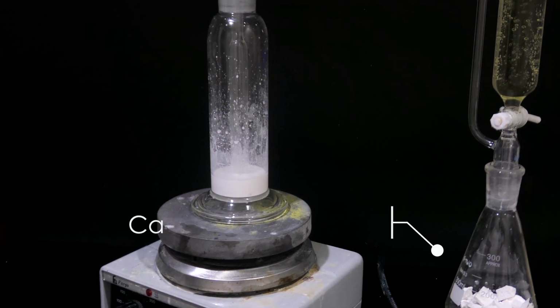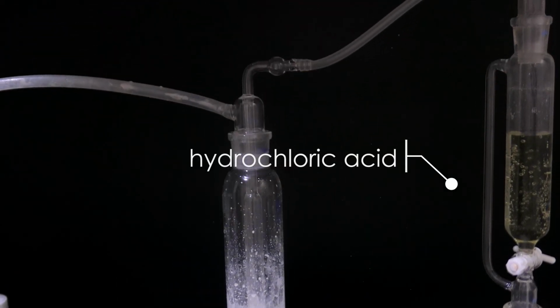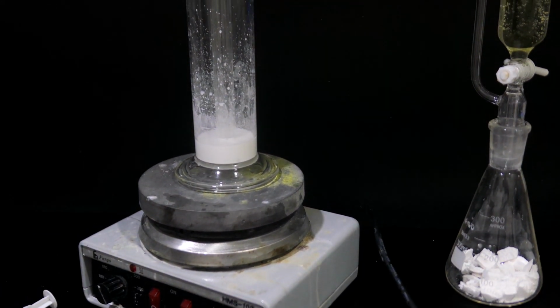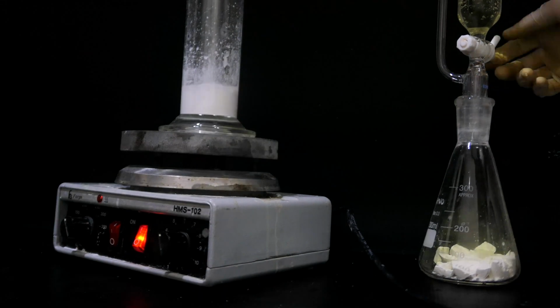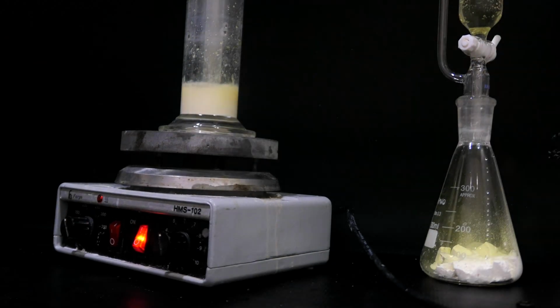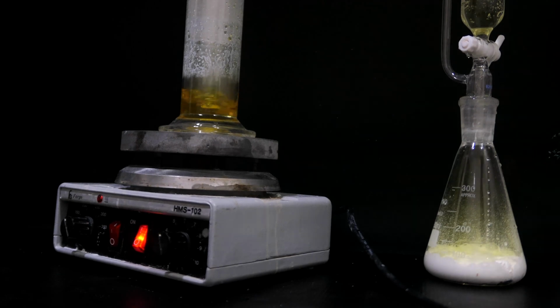After this, a chlorine generator is set up. The bottom flask is charged with some calcium hypochlorite tablets, and the addition funnel above is charged with some hydrochloric acid. Calcium hypochlorite can be replaced with TCCA or manganese dioxide. The tube above the chlorine generator guides chlorine into a bubbler. Then the chlorine will bubble through the antimony trioxide slurry, and excess chlorine will be destroyed by the inverted funnel trap filled with sodium metabisulfite solution.